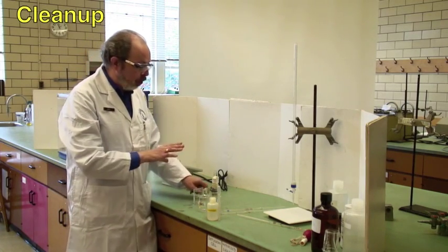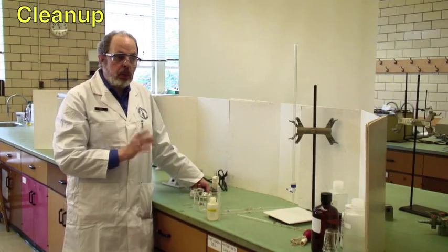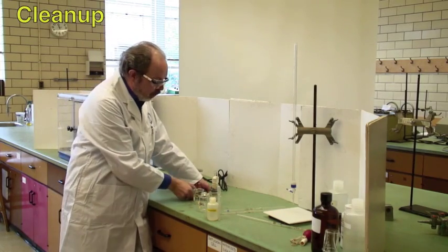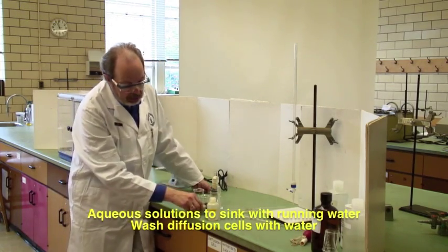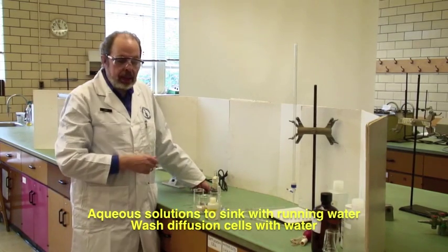In terms of cleanup, all of these solutions can go down the sink with lots of running water. Make sure that you wash these out, and they are stored back in the drawer.